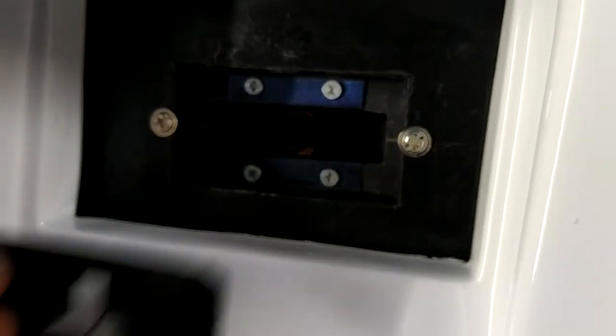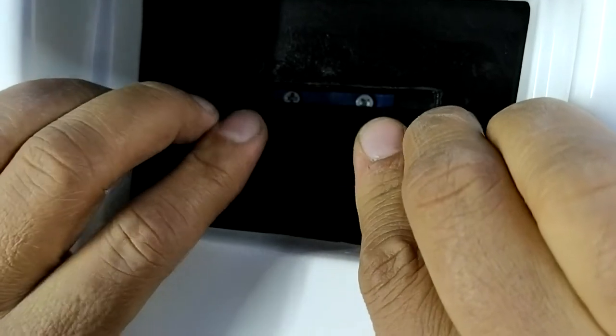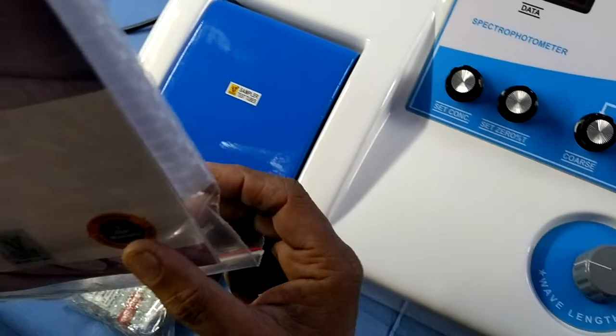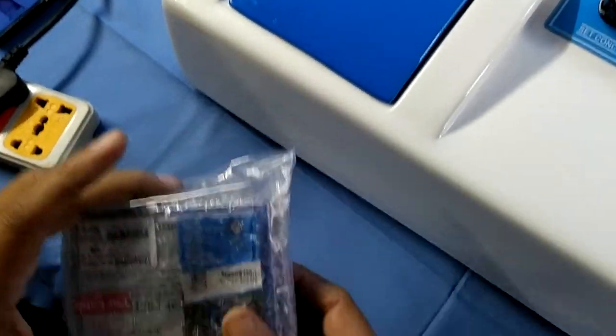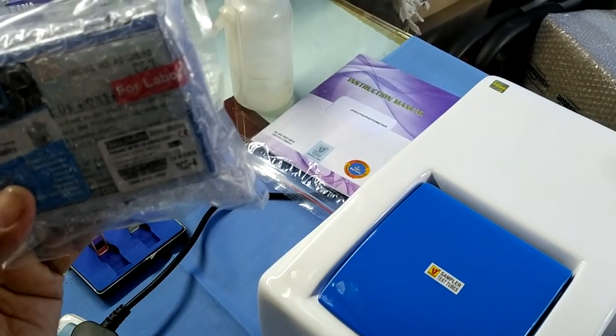Now I am using only 10mm glass cuvettes. For that, I am again placing this jack to the sampler. This is the main view, and these are the sides and the back controls. With this spectrophotometer, we supply: one instruction manual, dust cover, empty card, power cord, and 10mm glass cuvettes with model LJ301.